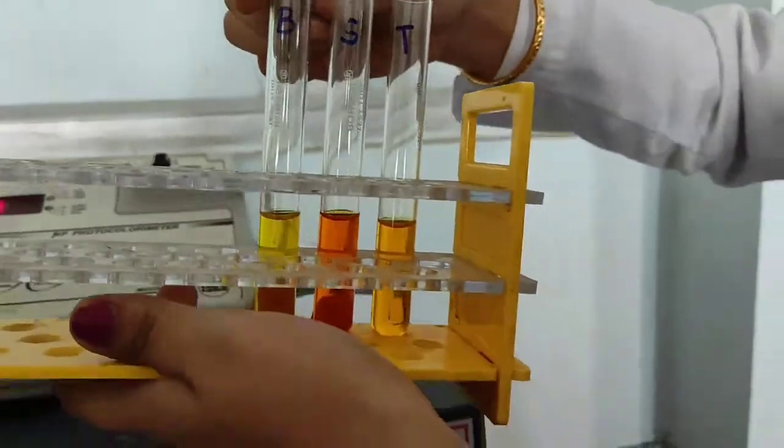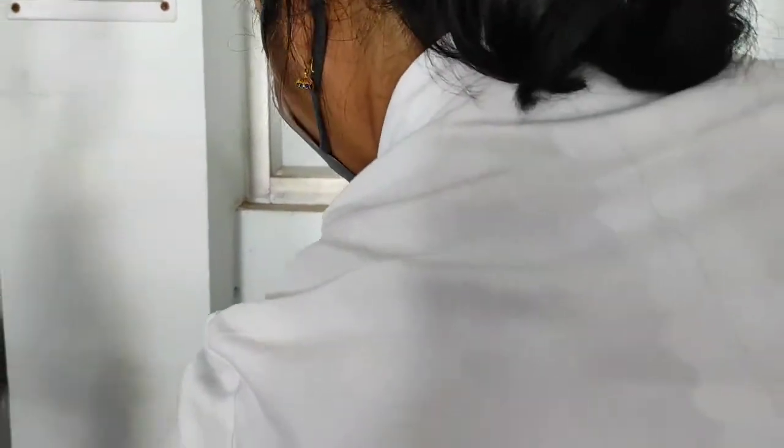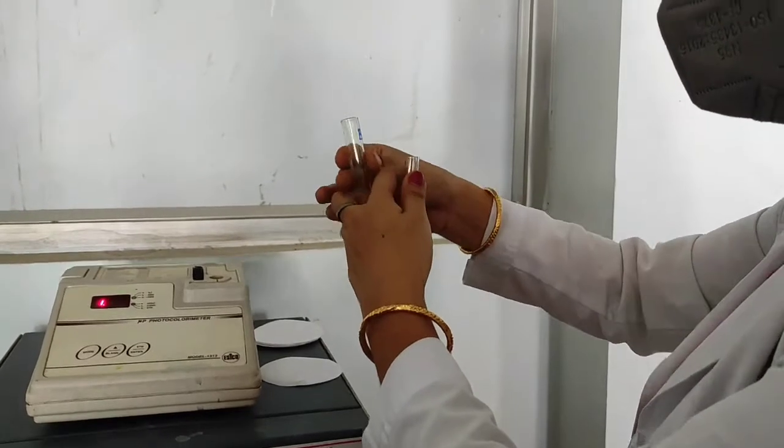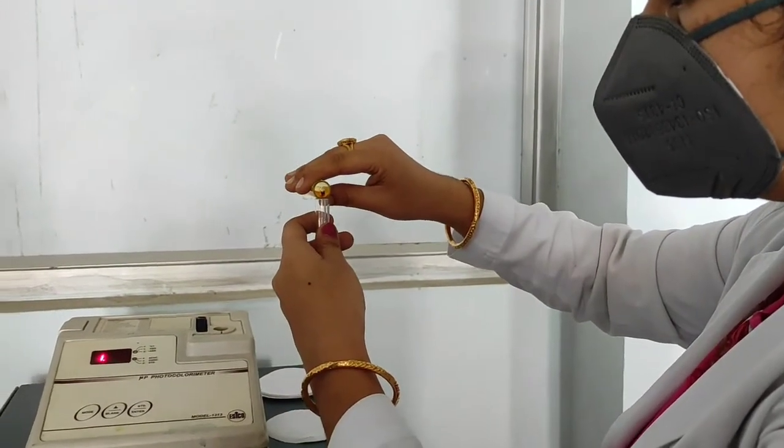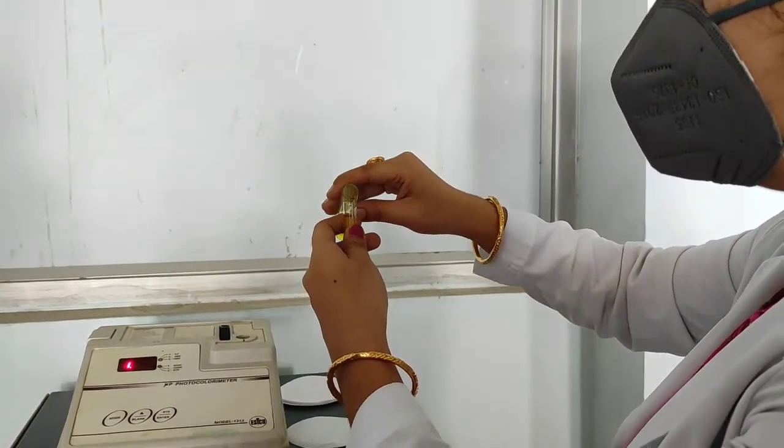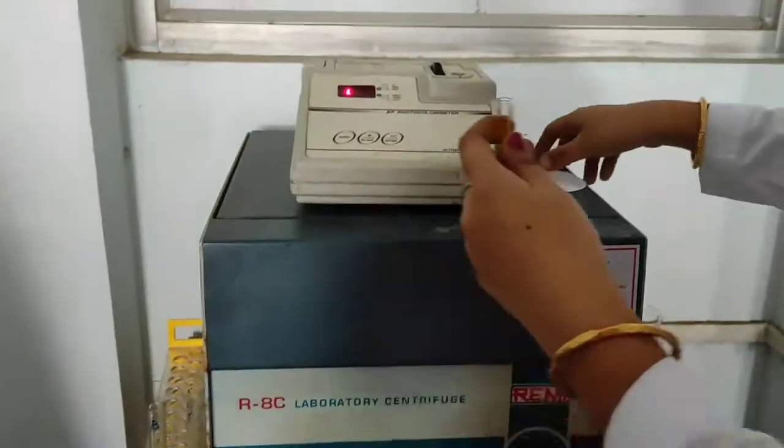First, I'll start with the blank. This is the blank. This is it.